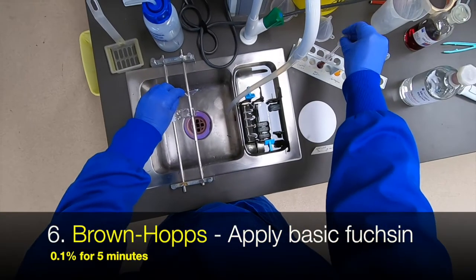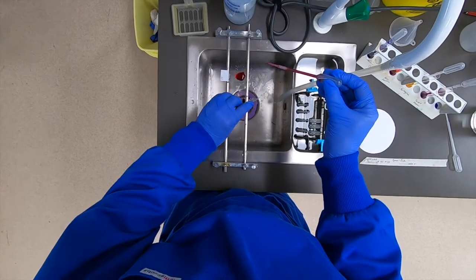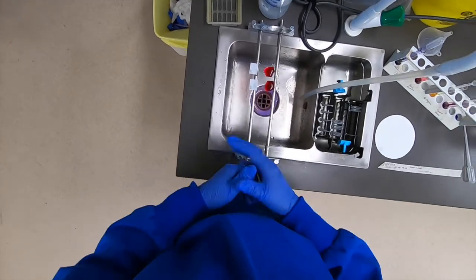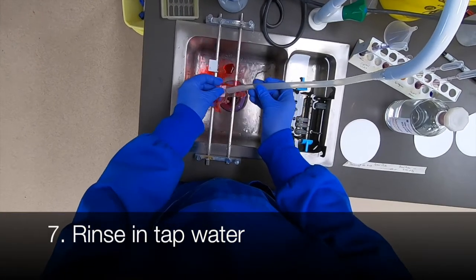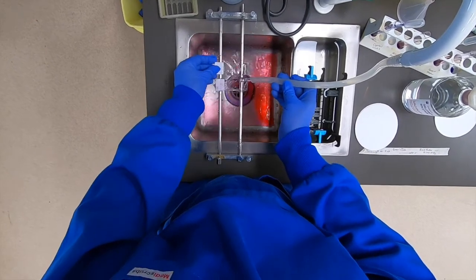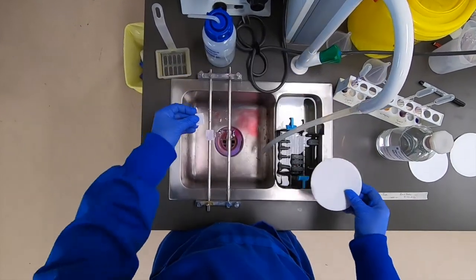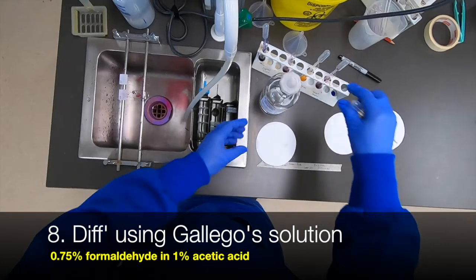Now let's go back and stain the other two slides and this time complete the protocol according to the Brown-Hopps method. In this case we'll begin with basic fuchsin, which is this bright pink colour. We apply that for five minutes, then subsequently rinse it off using tap water. Because this tends to over-stain the section initially, we then need to employ a differentiation step. You can see quite a red effect overall within the tissue, so we'll employ what is known as Gallego solution — dilute formaldehyde in 1% acetic acid.